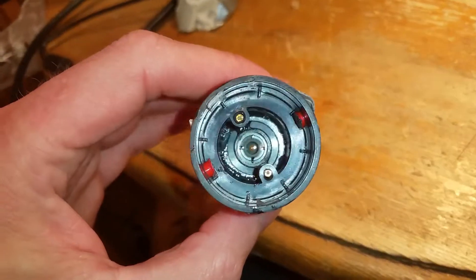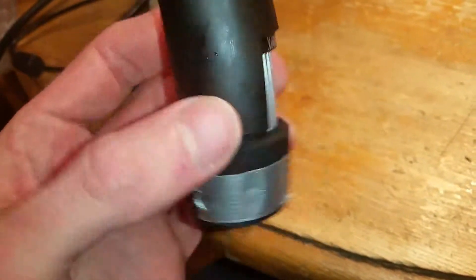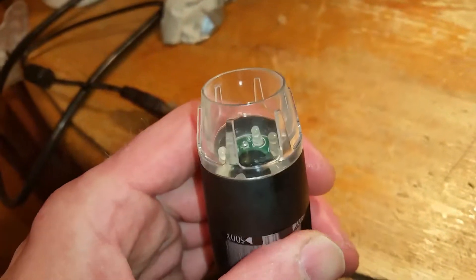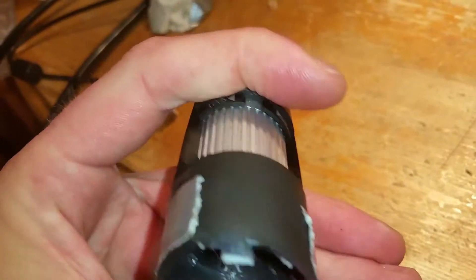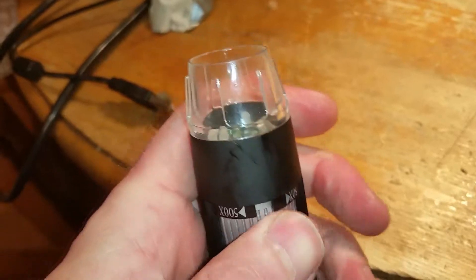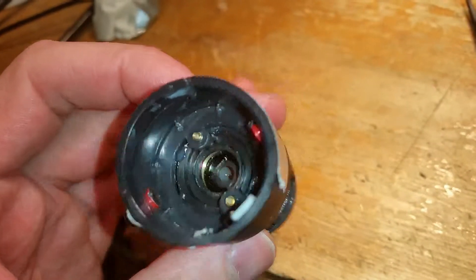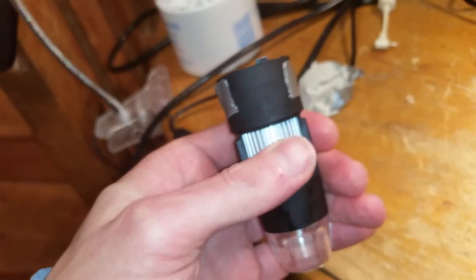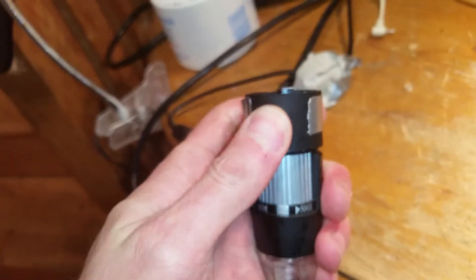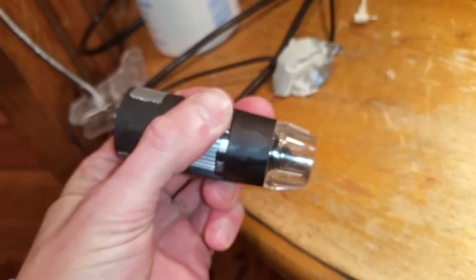With a little bit of patience that slides back in - it only goes in one way. There's a retaining clip on the zoom. Now we can zoom. I've got duct tape on the side of it to stop the buttons falling in. Now we can zoom - if it won't zoom it's because that needs to be shoved forward a little bit. But now we can zoom.